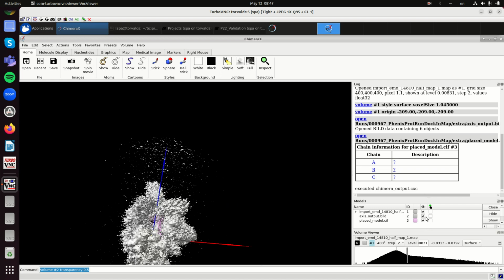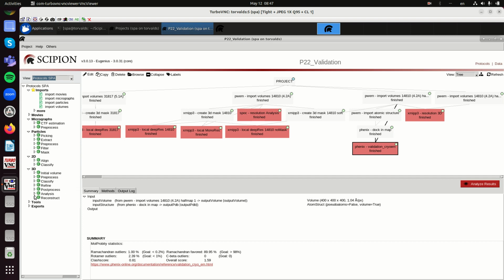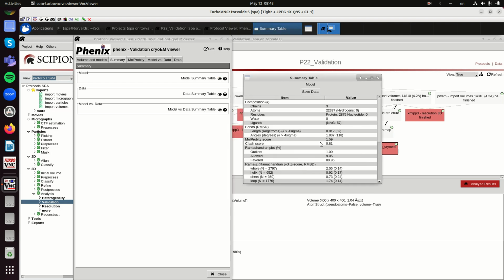Okay, so from now on we can analyze and compare this PDB to this map, and you have multiple tools for that. Here you have the validation tools that we have for when you have a PDB and a map. Here are a few of them, and if you go to single particle analysis, post-process, analysis, and then validation, you also have multiple possibilities. These ones are purely based on the map, and the other ones are based on the map and PDB. Okay, so let's look at the analysis of this one. The validation criterion of Phenix: this report is very rich, so you can spend a lot of time looking at all the small details of the report.